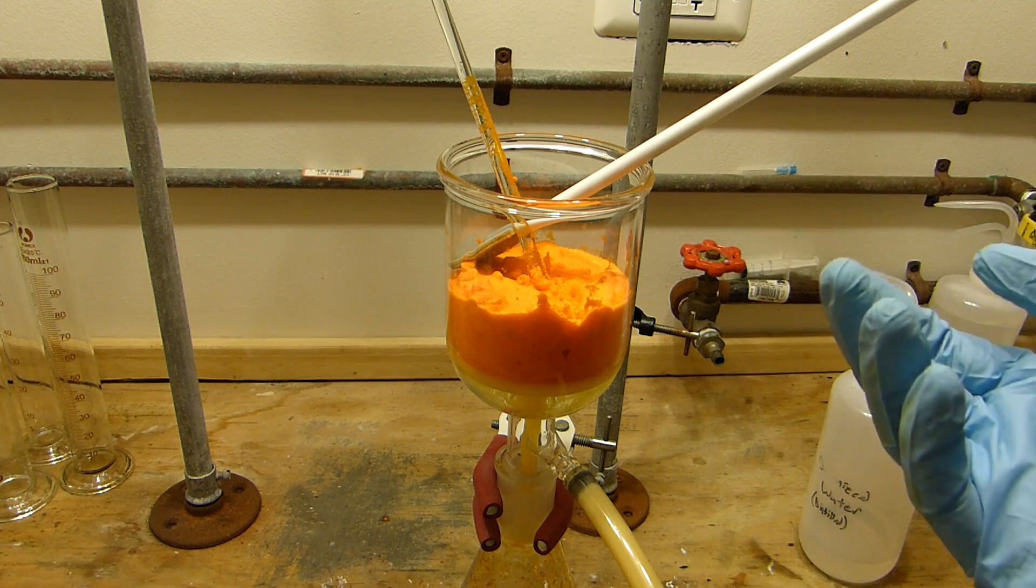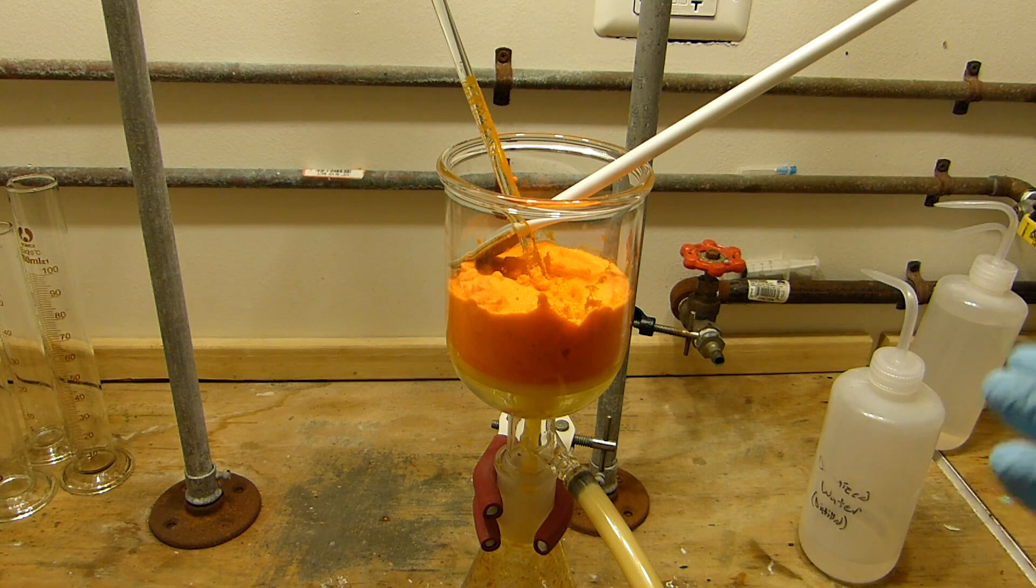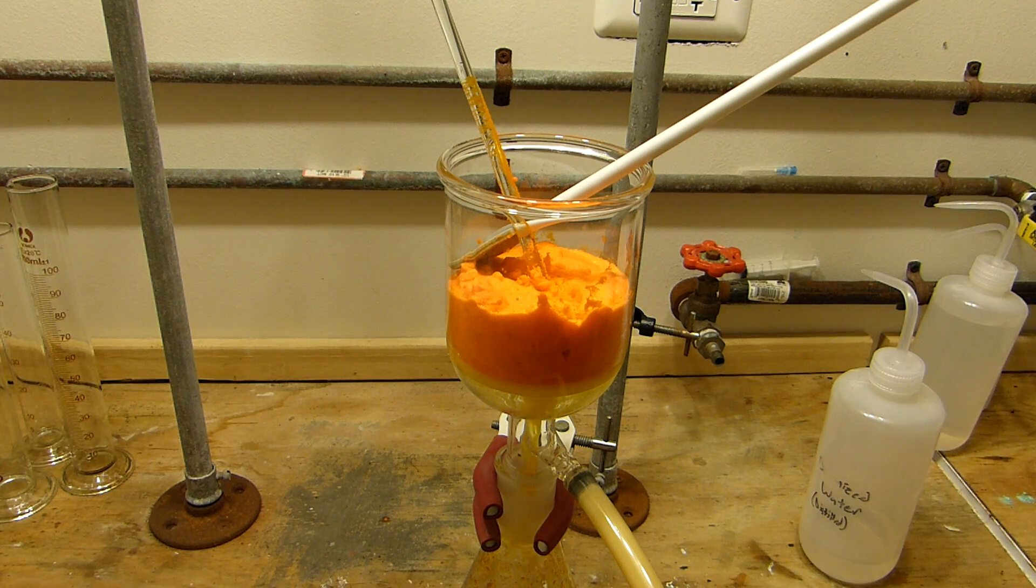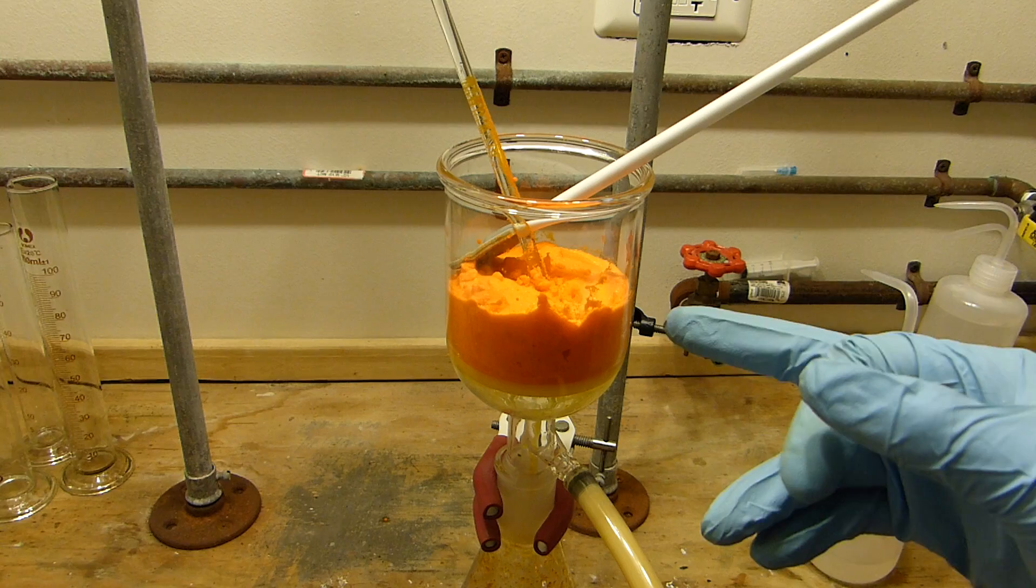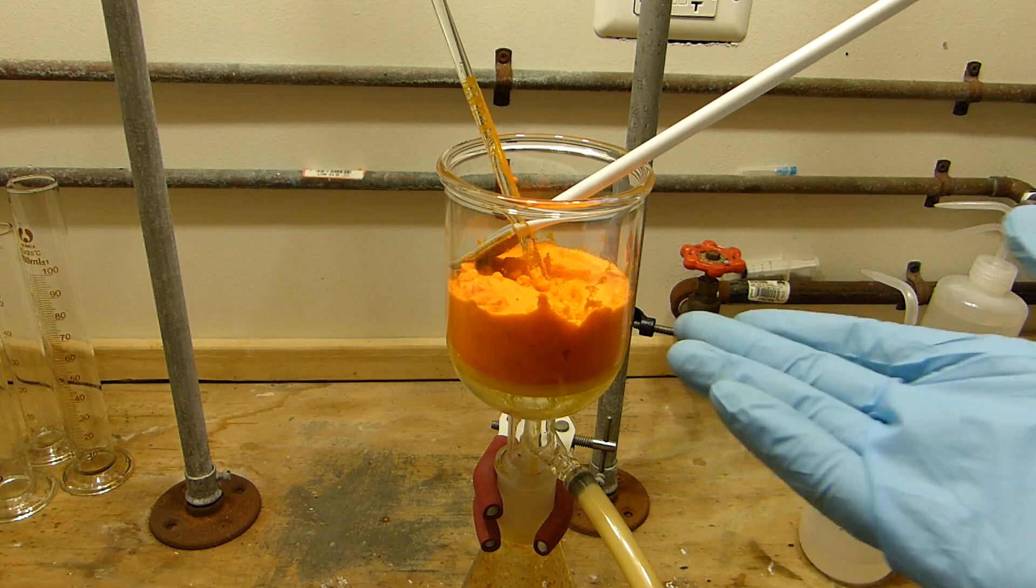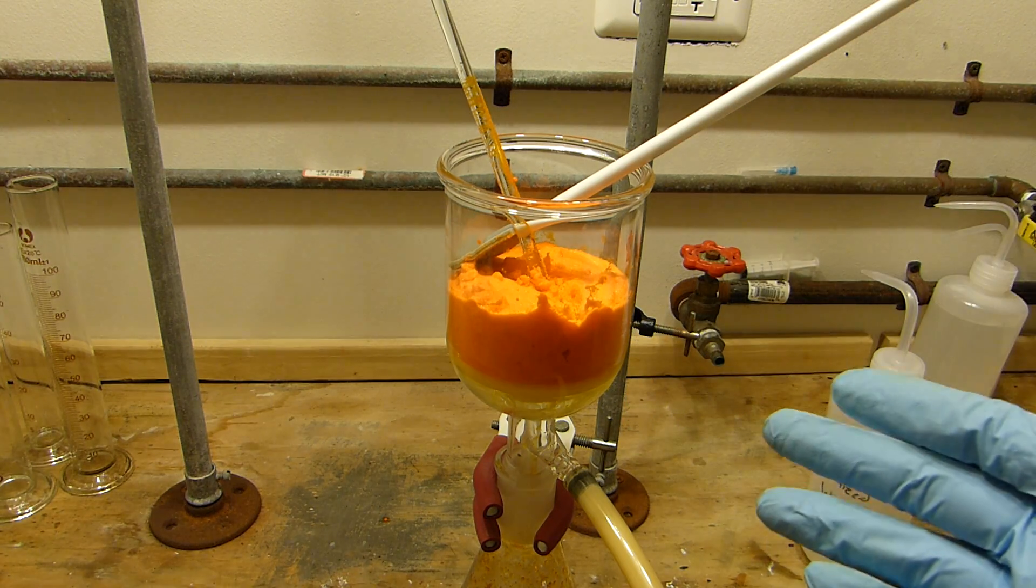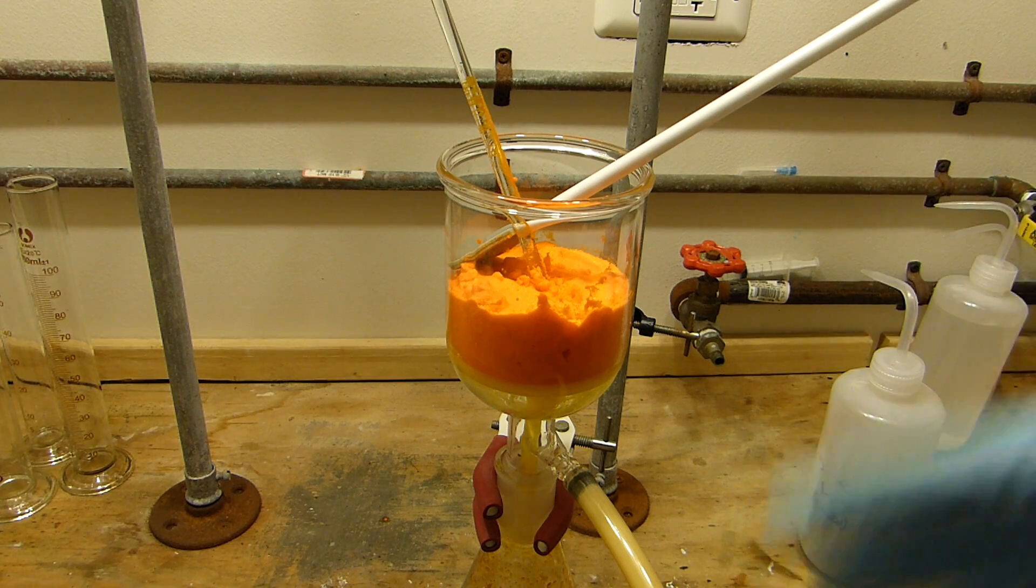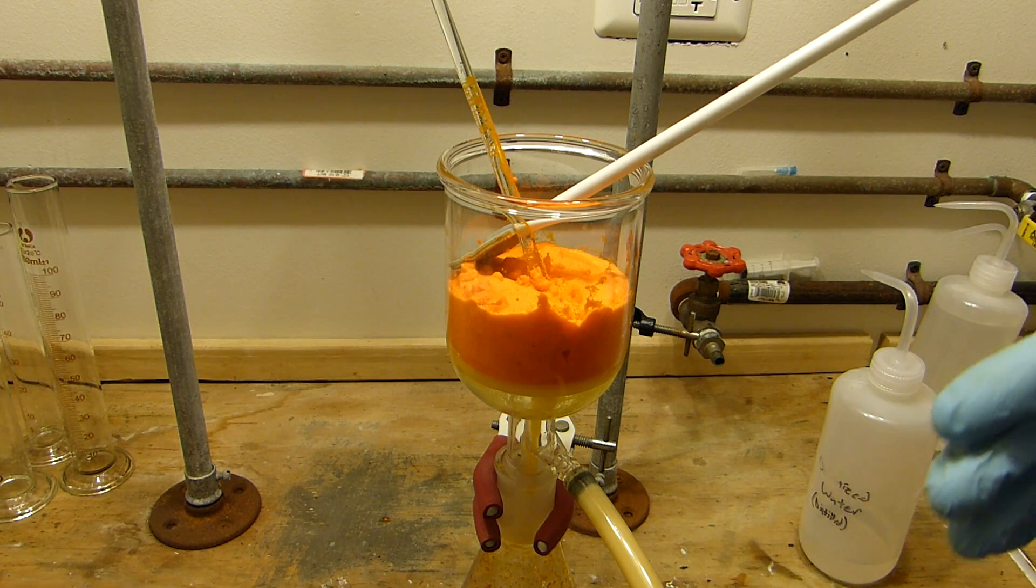And some chromium trioxide although with a little bit of excess pyridine you can eliminate that. So long story short we don't need to wash this because since the contaminants are volatile during the drying phase as long as we have a good fume hood we can just simply drive those off and it won't pose a problem.